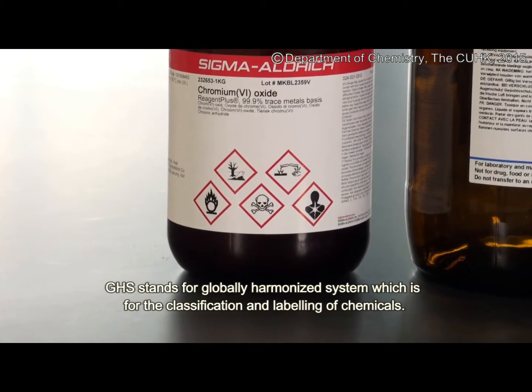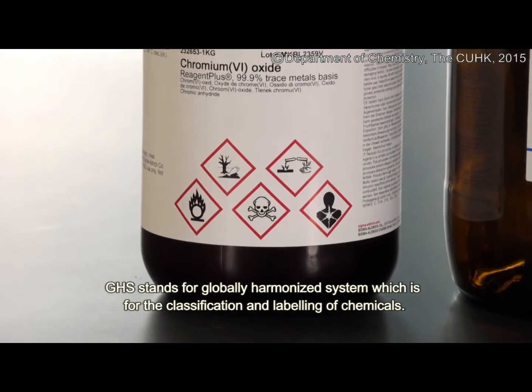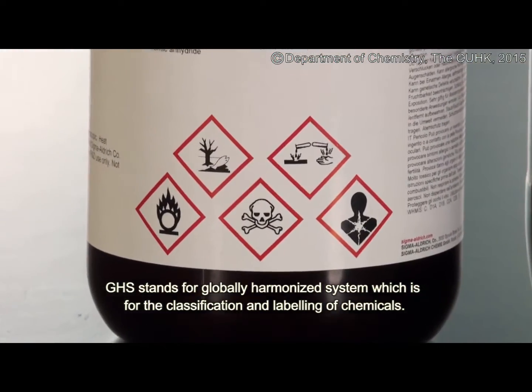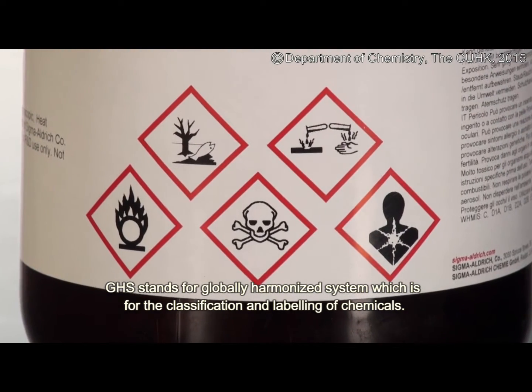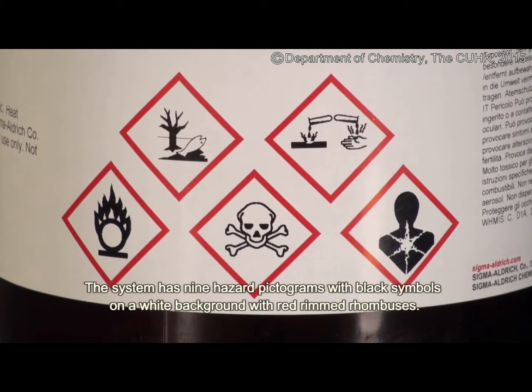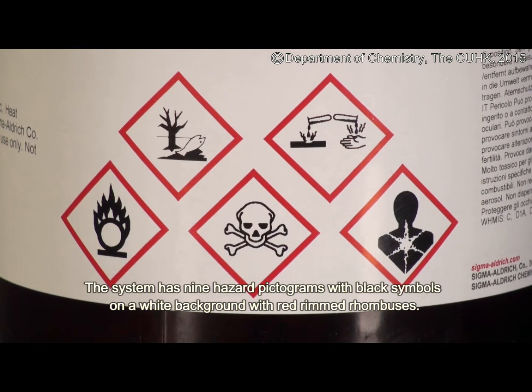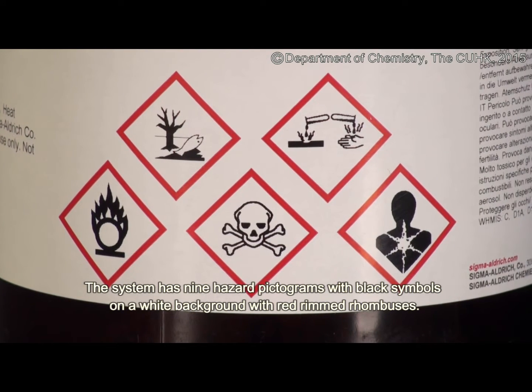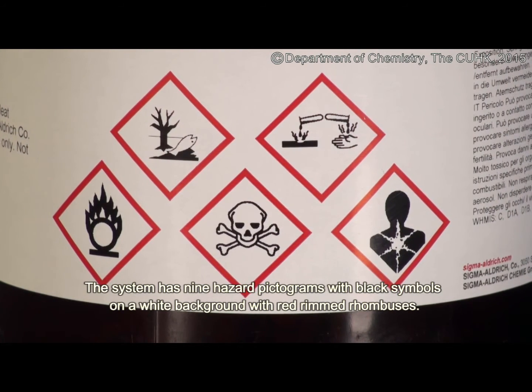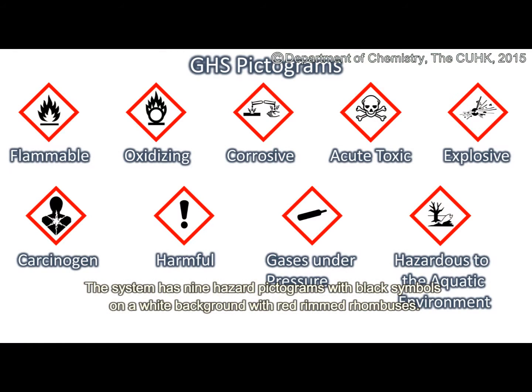GHS stands for Globally Harmonized System, which is for the classification and labeling of chemicals. The system has nine hazard pictograms with black symbols on a white background with red-rimmed rhombuses.